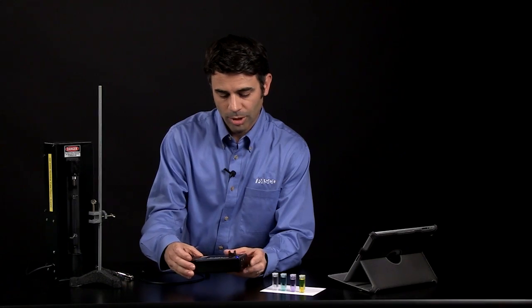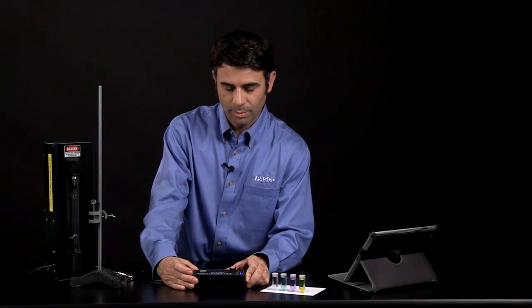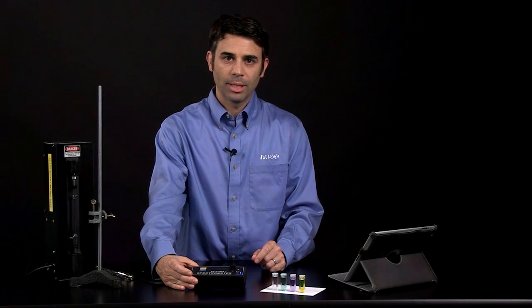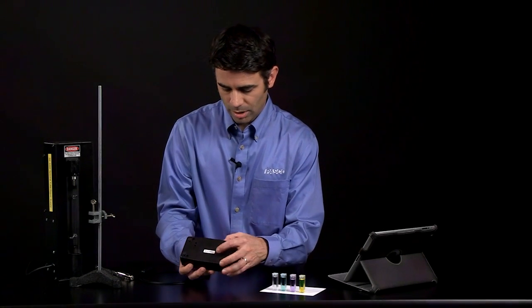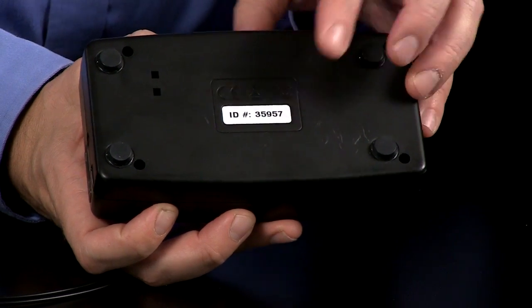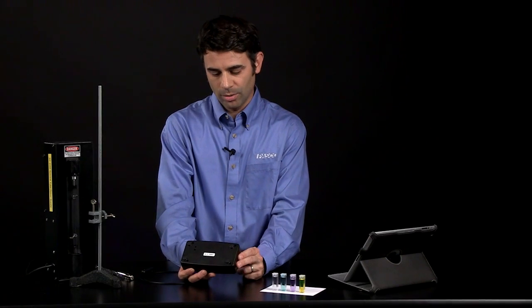I've already turned the spectrometer on, and I've connected it via Bluetooth to an iPad. I did that through the Bluetooth settings using the spectrometer ID number, similar to the way we pair SparkLink Airs and AirLink 2s.